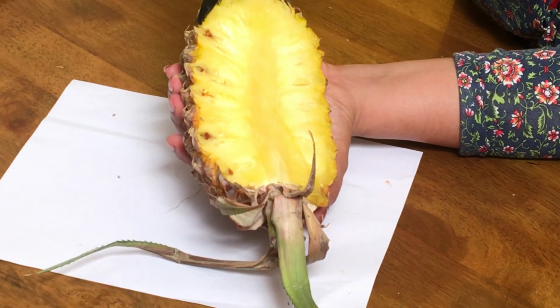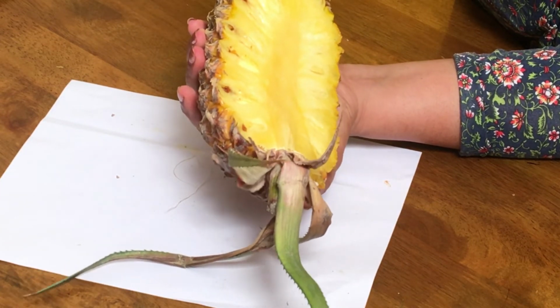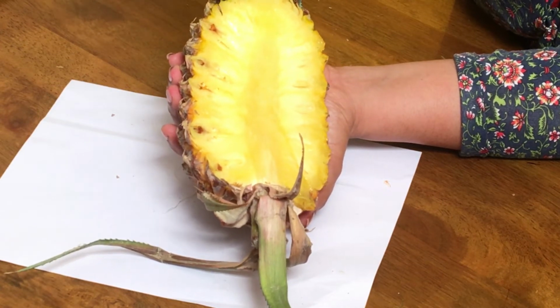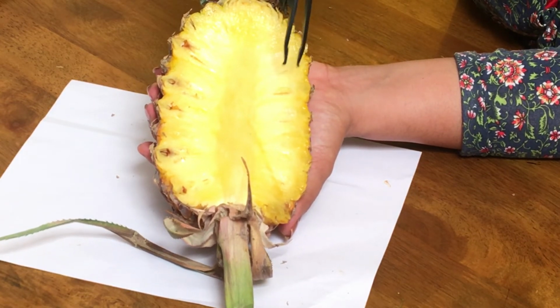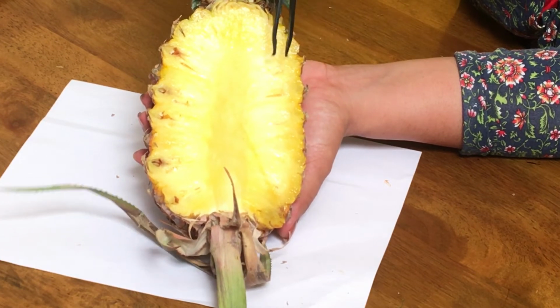So it's actually a flower. Okay, here you can see all these structures. You can see the stigma, you can see the stamen, all these things here which we generally don't eat. Okay, we remove this part, isn't it? We eat only this fleshy part, and this fleshy part is mainly the sepals, bract and the ovary which became ripened and became yellowish and juicy.